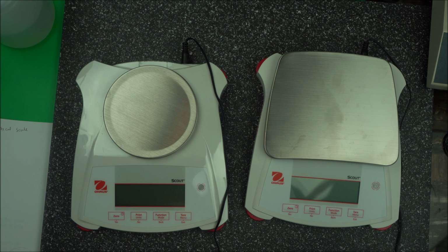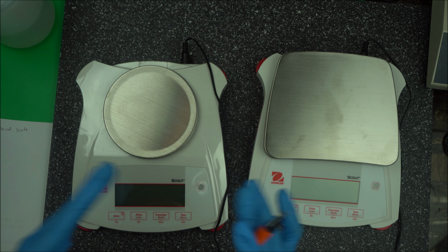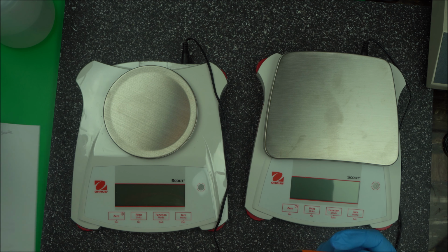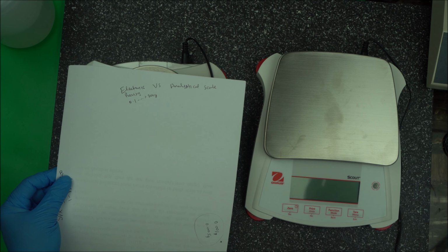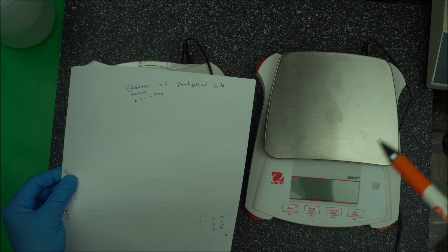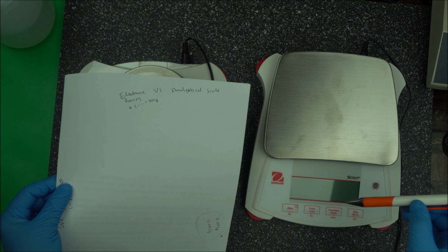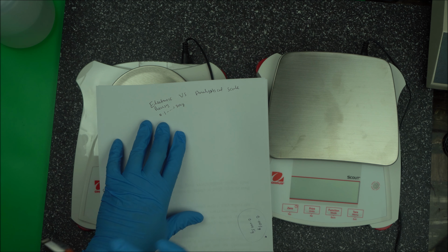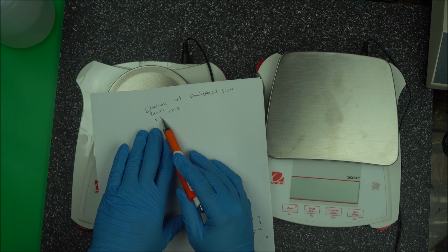That is very expensive, but for cosmetic formulation you do not necessarily need it. If you are making pharmaceutical products, you will need that. But in cosmetic formulation, you are okay with a scale that starts with 0.1. You are good, depending on what you are formulating though, so keep that in mind. Also, some cosmetic formulators do have very small amounts of ingredient in their formulation. In that case, you will need an analytical scale, but that is not for this video. So basically, for most home-based formulators, what you need is an electronic precision scale that starts with 0.1.